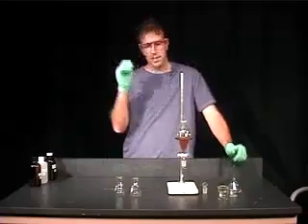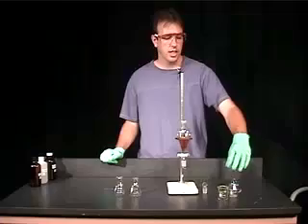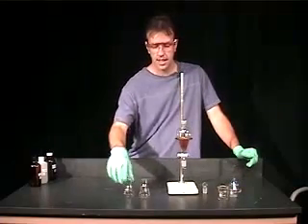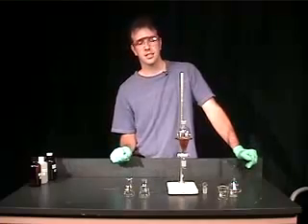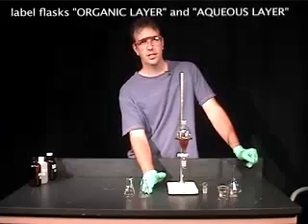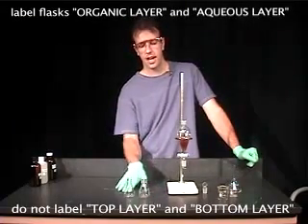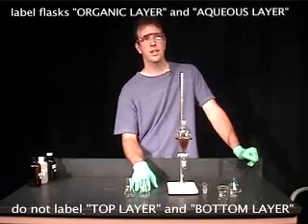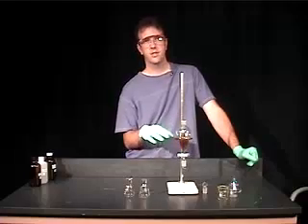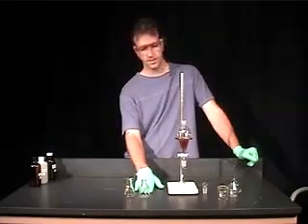While these two layers are separating, which may take a little while, you should label your collecting flasks. In this case, I have two different collecting flasks, one labeled for the organic layer and one labeled for the aqueous layer. It's very important that you don't label these top layer and bottom layer, because that's not very descriptive. The top layer and the bottom layer may change depending on the densities of your solvents. So: organic layer, aqueous layer.